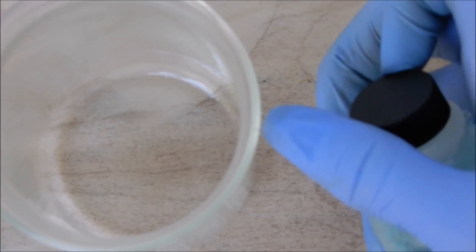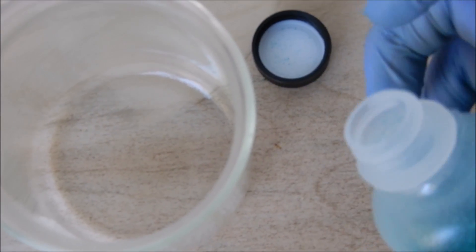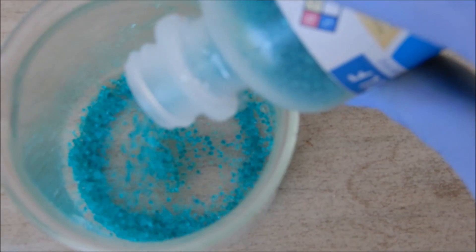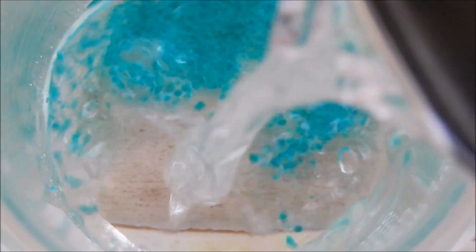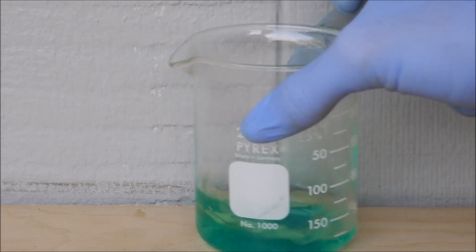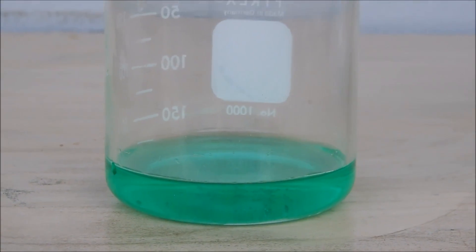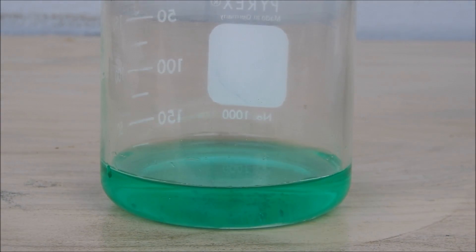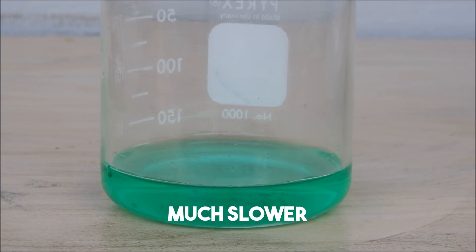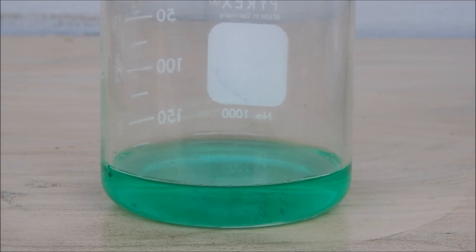Alright, here's the nickel sulfate solution. Let's add the sodium much slower than the last time because I'd rather have less violent, less unsafe than that last time. This time I'm behind my blast shield and let's add that natrium.